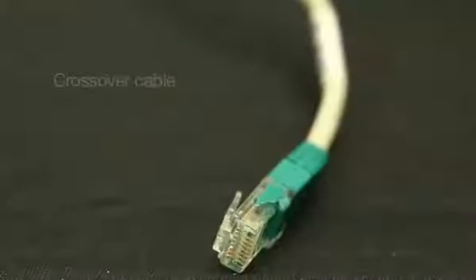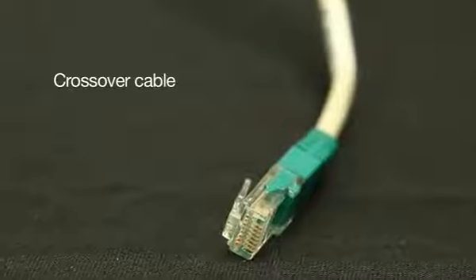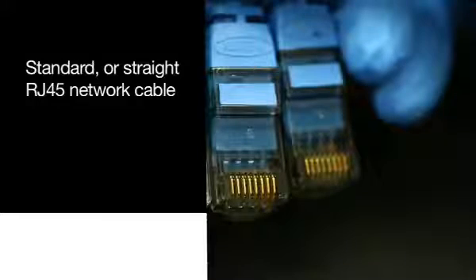How to identify cables. A crossover cable is used when the SlideMate is connected directly to the PC. When the SlideMate is connected to a network, a standard or straight RJ45 network cable is used.